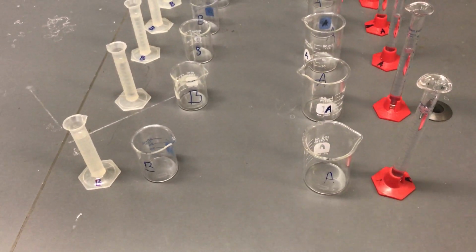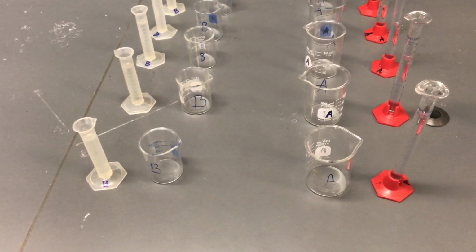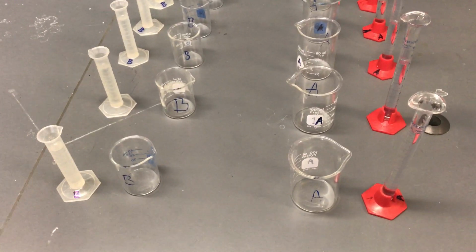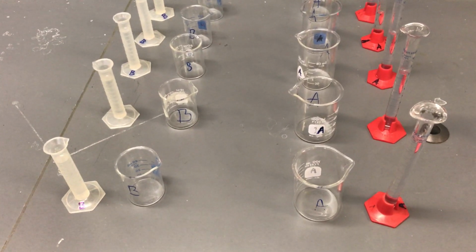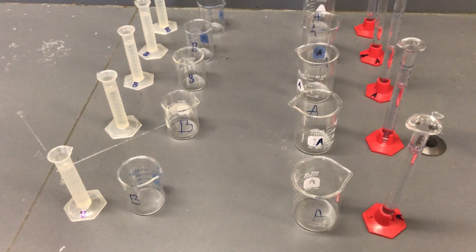All right, in this lab, this is the rates of reaction lab, and this is for the iodine clock reaction. And the indicator we're looking for is a positive test result between an iodine and a starch. And so in previous classes, like in biology, or maybe if you've taken a food science class, you've done iodine starch tests, and you get that blue-black color.